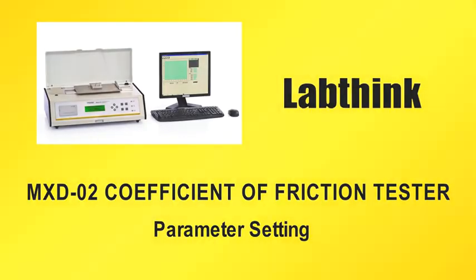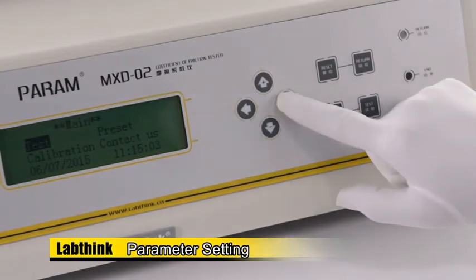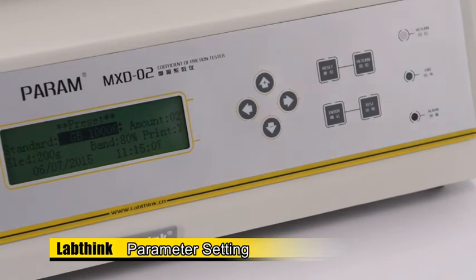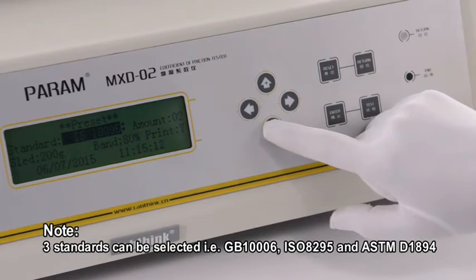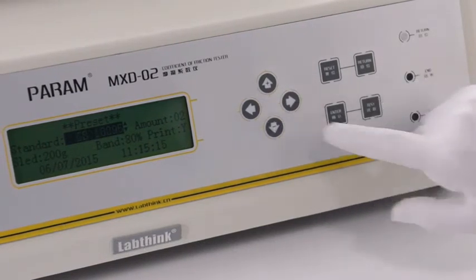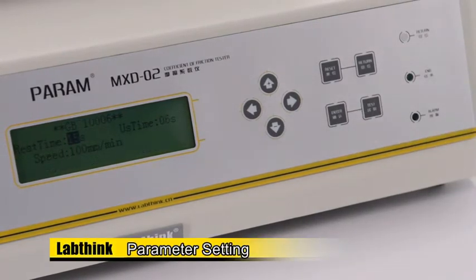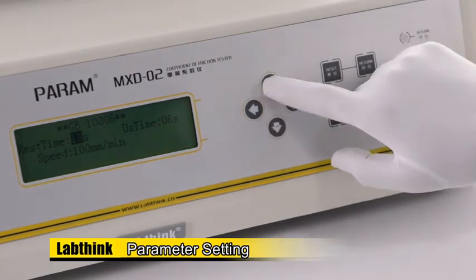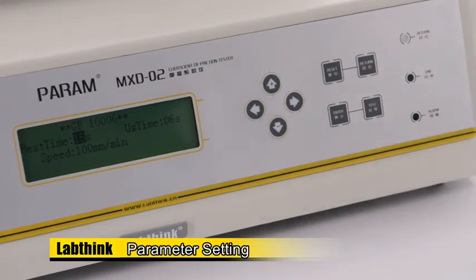Parameter setting. Move the cursor to Preset by pressing the left and right arrow keys. Press Enter to enter the preset interface. Press left and right arrow keys to move the cursor to Standard and select standard GB10006. Press Enter to set parameters. Set rest time as 15 seconds, which is the time when the sled rests on the specimen. Press Enter to save the setting.